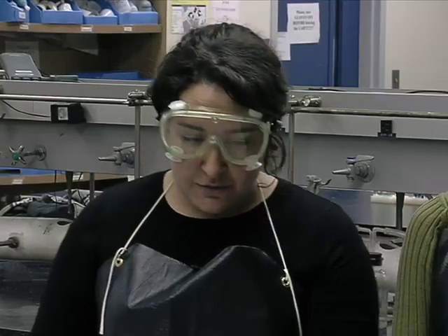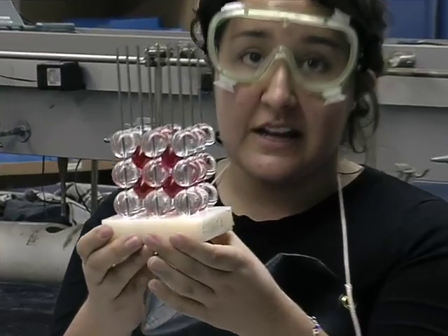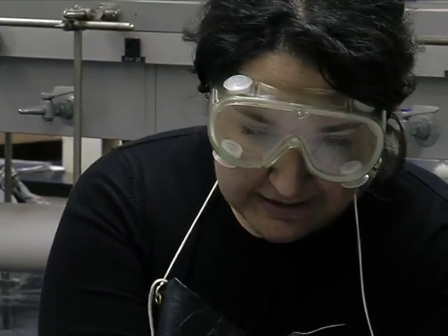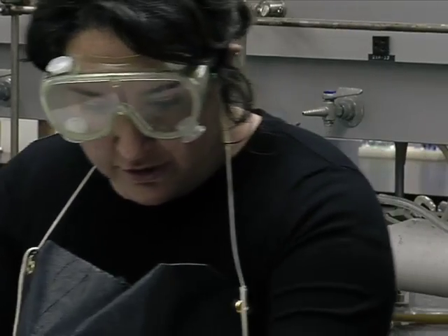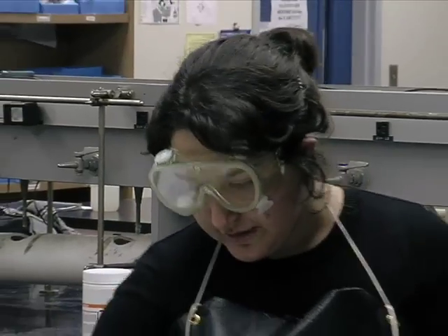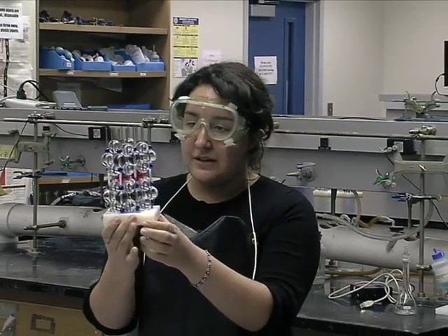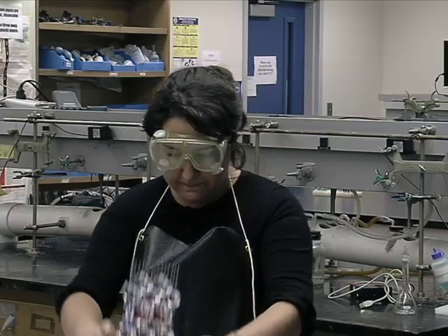In this lab, we will be examining nitinol and a 1,2,3 superconductor. Nitinol has two forms: austenite, which is body-centered cubic, and martensite, which is more disordered. Austenite occurs at higher temperatures and is therefore more ordered than martensite. We will also be working with the 1,2,3 superconductor, which is named 1,2,3 because of the ratio of the atoms of copper, yttrium, and barium.